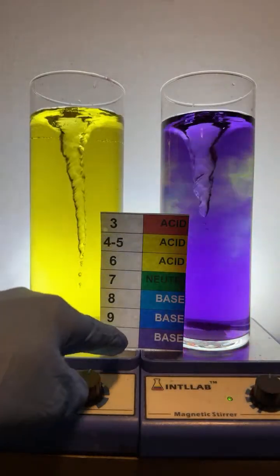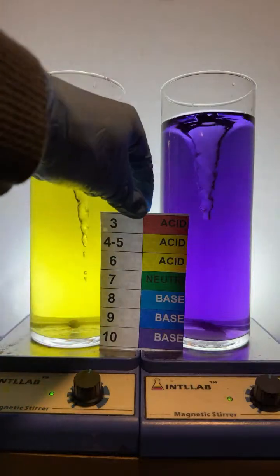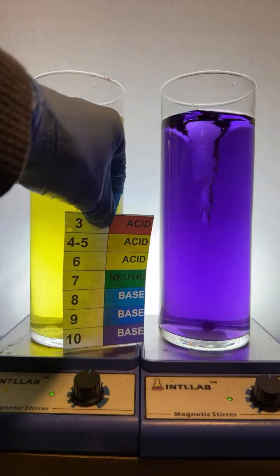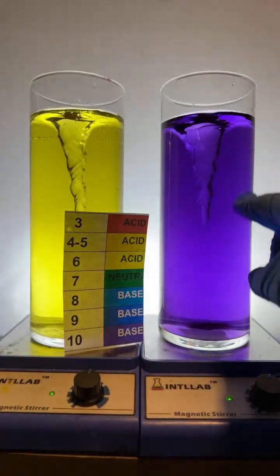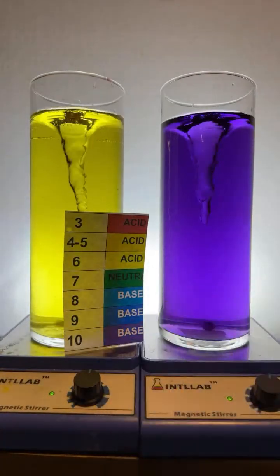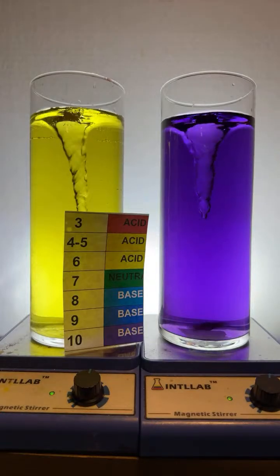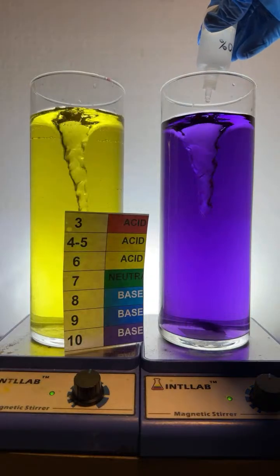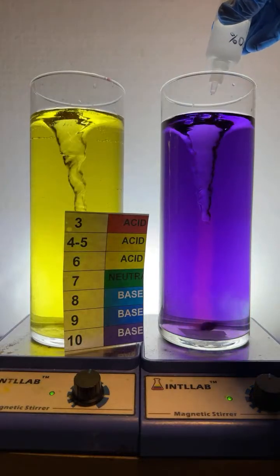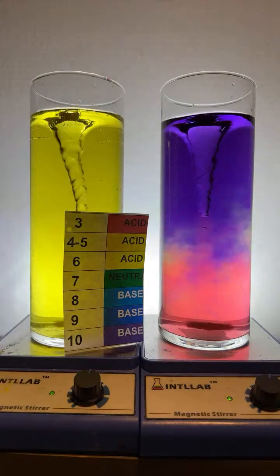You can see the pH scale right here that I've got listed, so you can see the different colors that you might see in the flask. Right now in this flask, the pH is 10, which means it's very basic. And if I add acid to this system, up here at the top, you can see me do it right here. I'm going to add 3 drops of acid, 1, 2, 3. And when I add those 3 drops of acid, the color changes.